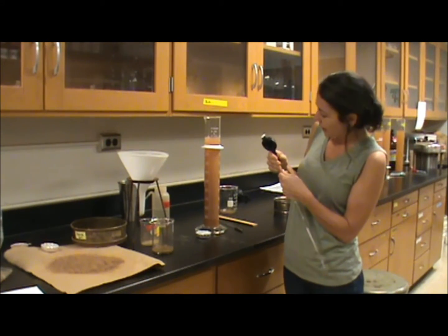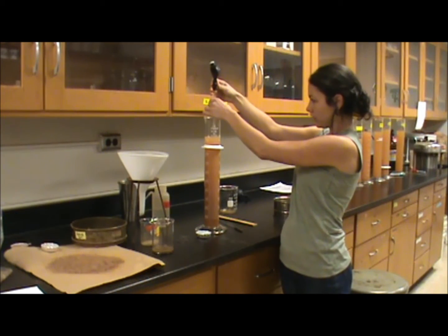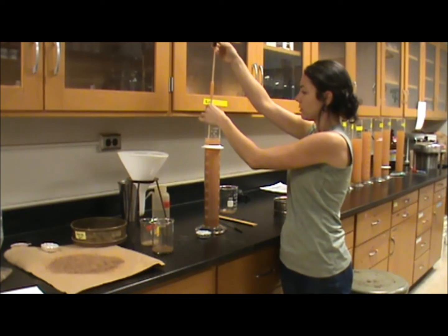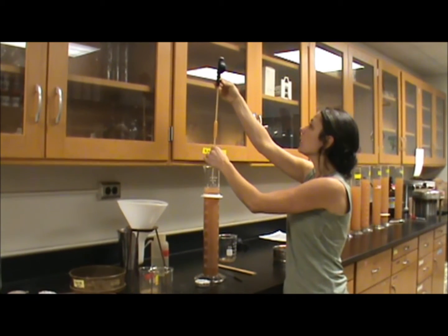To determine the clay content, we're going to pipette up 10 mils of just the water, the solution that holds the clay.